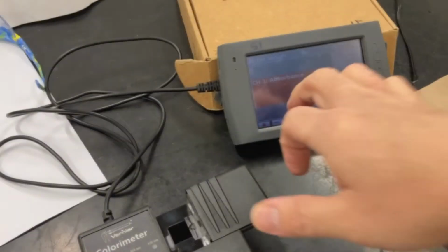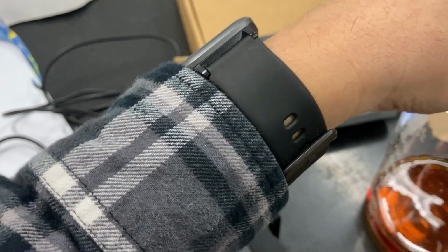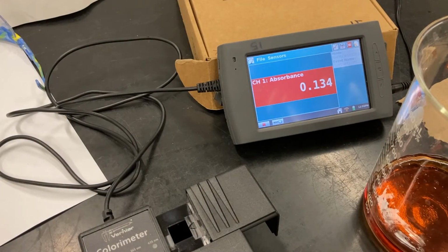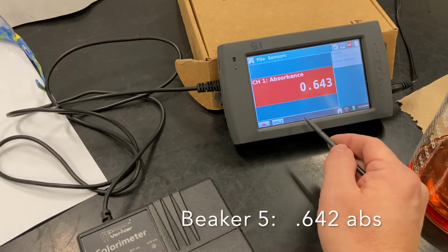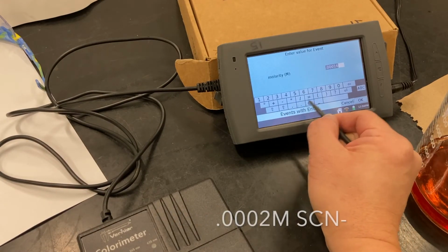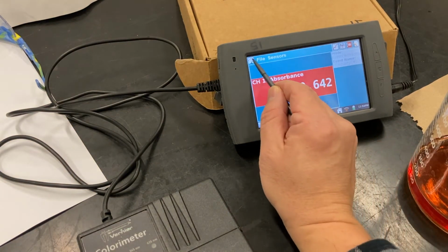Okay. All right, and solution 5. All right, so it's going to be 0.0002. All right, and so those are our values.